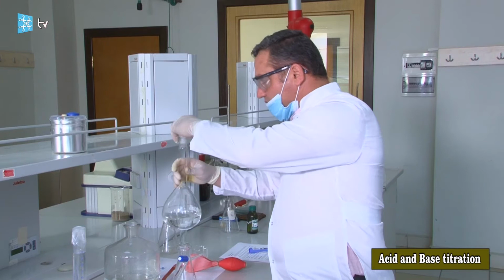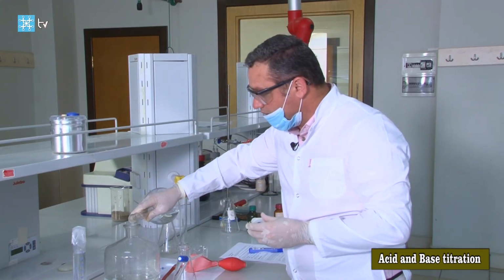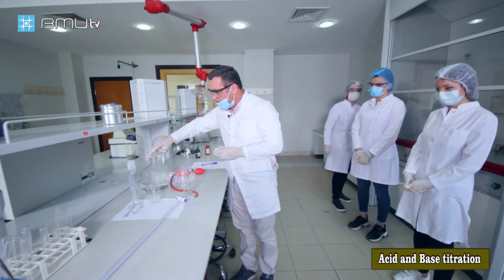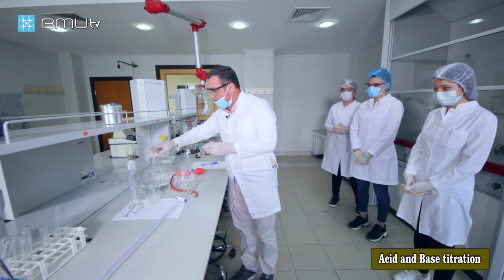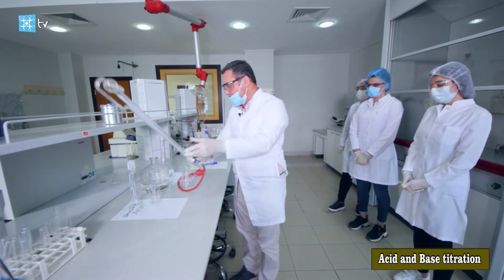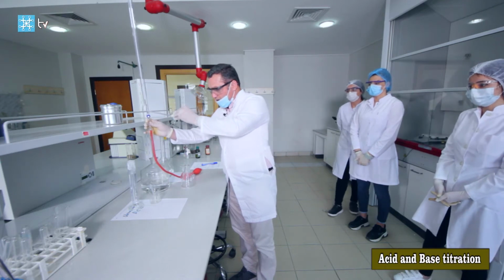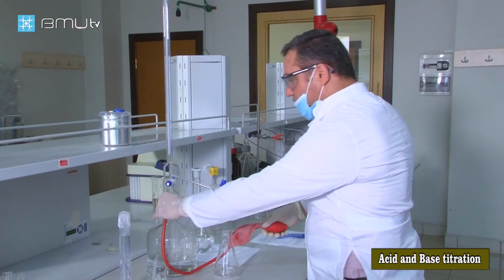I pour our standard sodium hydroxide solution into the burette. We know the concentration, and let's fill the burette with this solution.